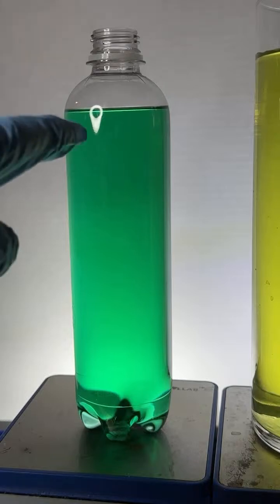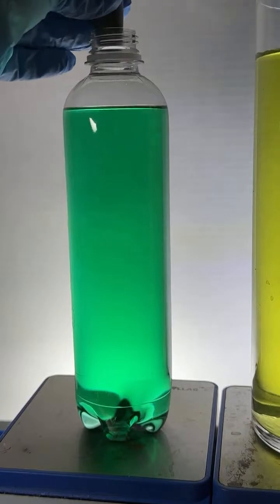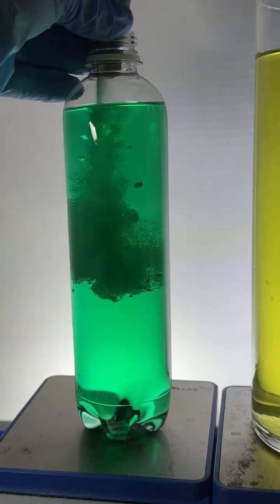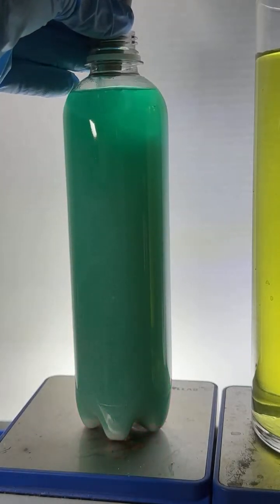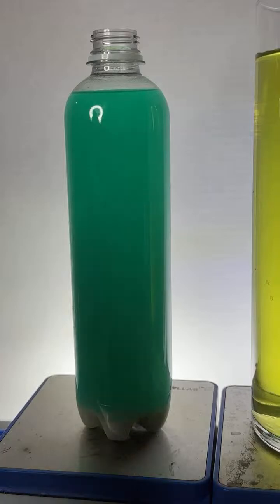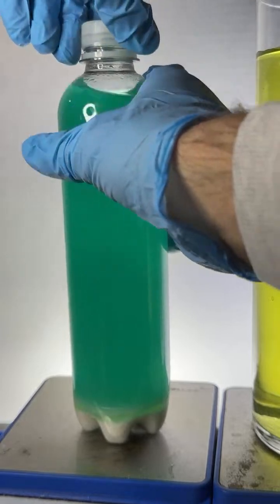Okay, here we go. We got this green fluid, and to that green fluid, I'm going to add a white solid, and we're going to watch what happens. Put this little funnel up here. I'm going to pour this in through the funnel. You can see it being added at the top, and in goes the solid. All right, let's mix that baby up, and let's see what happens. So I had that green liquid, and we'll mix it up and hope, who knows what'll happen.